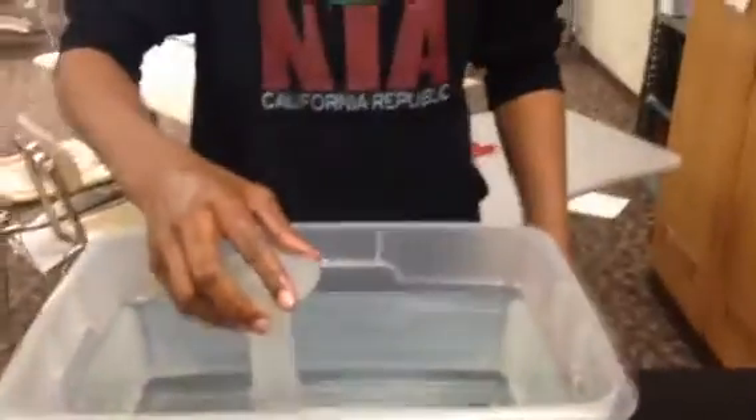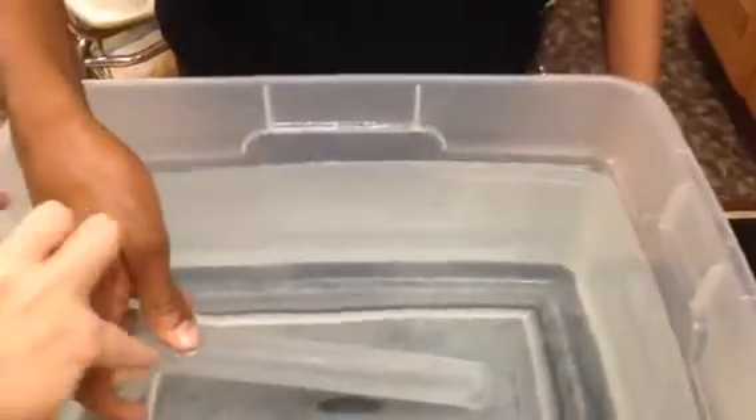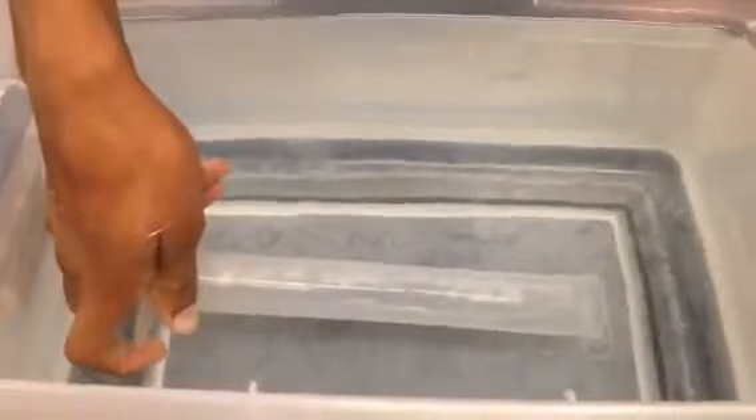You're going to want to tilt it on its side and turn it so that it'll go completely full of water. You're going to want to push the bottom down underneath the top. I think I still see a big air bubble — can you get that air bubble out? You're going to want to tilt it the other way. Okay, that looks full.